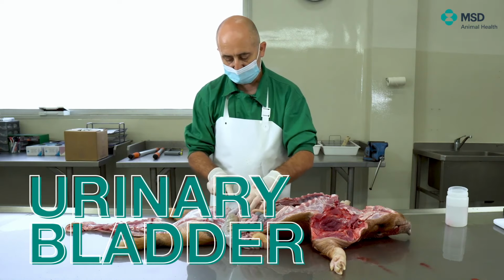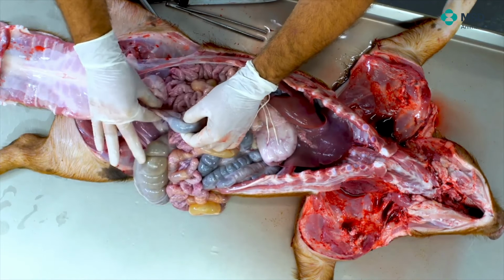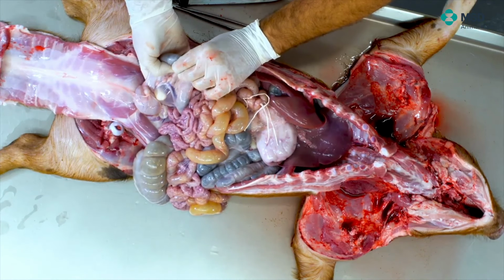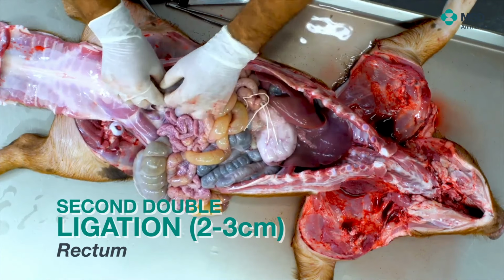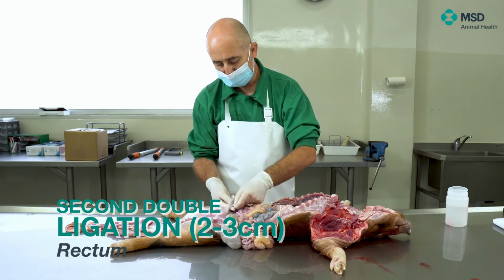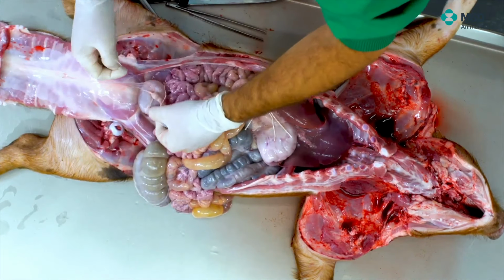The rectum usually is plenty of feces, so what we prefer to do is just to remove the feces to one side, especially to the upper side, and then the ligament that we can see here, we are also, even with the finger, going to cut it, and we will make the 2 knots exactly here. So we will take again the strings, as you can see here, and we will do the 2 knots. With this procedure, what we avoid is basically the presence of feces when we are removing all the intestinal loops.